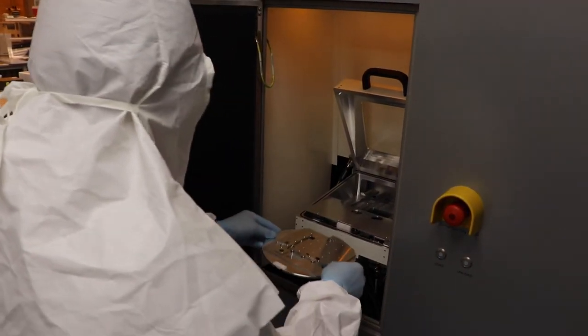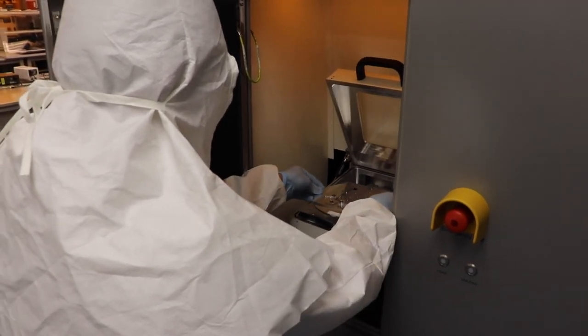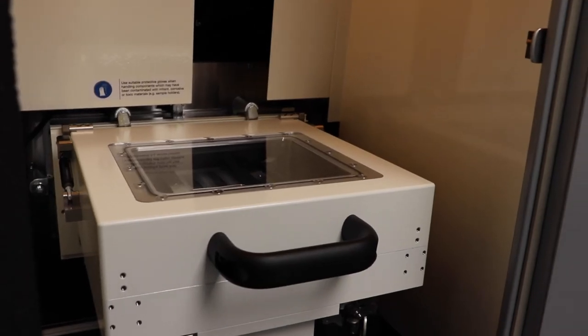To start the process, the silicon wafers are inserted into a sample holder, which is then inserted into the microscope.